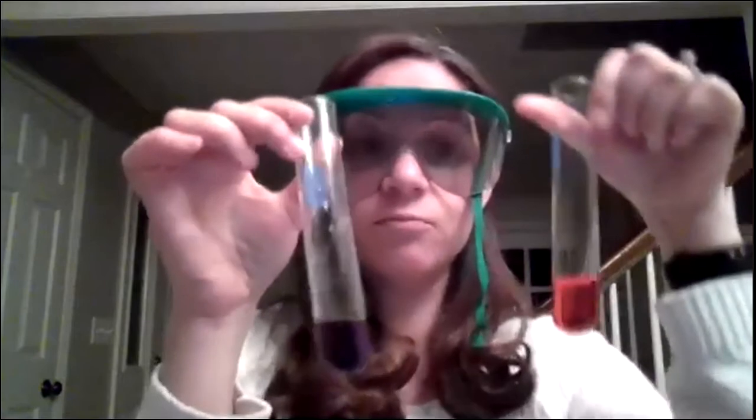Now let's try the same thing, but my water with some NaOH. So again, 0.1 molar NaOH, so pretty low concentration. And I'm just going to add a drop, and it goes to purple. So again, dramatic shift. I go from pH of 7 to pH of probably 12 or 13 or so. So this would not be a buffer. Water is not a buffer because with very minimal amount of H pluses or OH minuses, I change the pH dramatically.